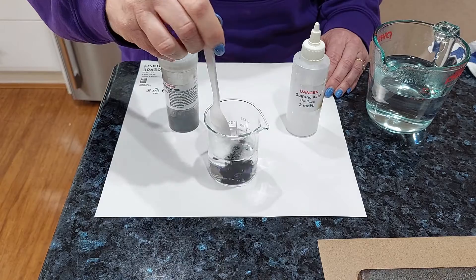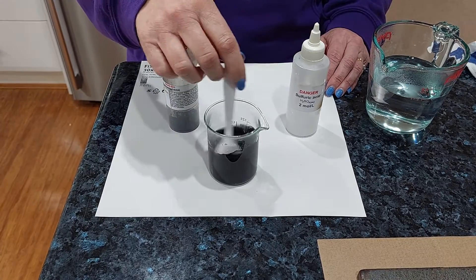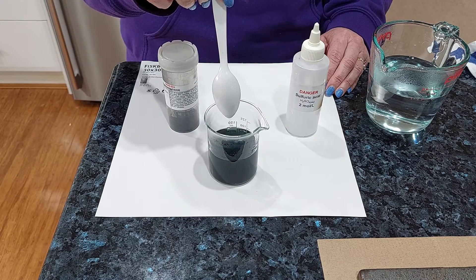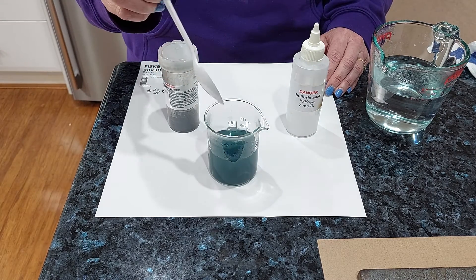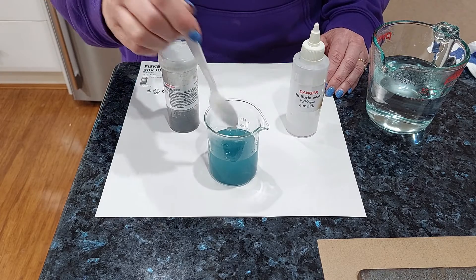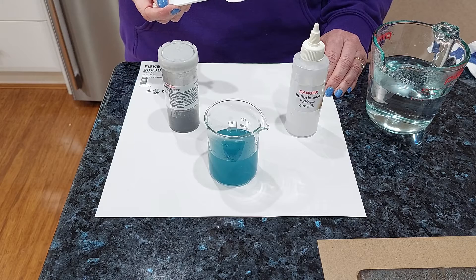Okay, here we go. We're watching now — we're looking for a color change to occur. Can you see a color change occurring? Look at that — it's gone blue! Our black powder is still a little bit on the bottom; I'll just stir it in. Our black powder has disappeared and we are left with a blue solution.